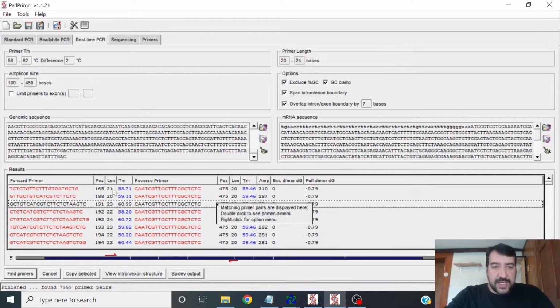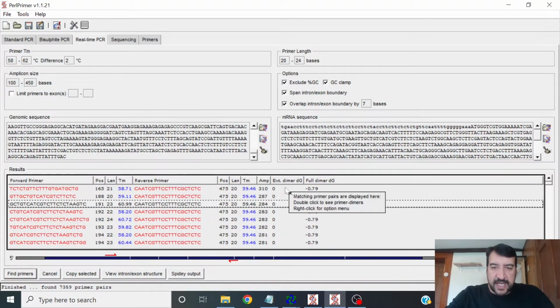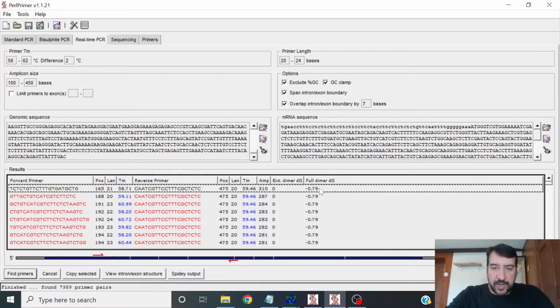And so what you see is that they're already sorted in terms of their extensible dimer and their full dimer. So the program is automatically picking out things that have low value, like not favorable values here. The more negative a value is thermodynamically, the more it happens automatically. A positive value needs energy to go in to form that complex.